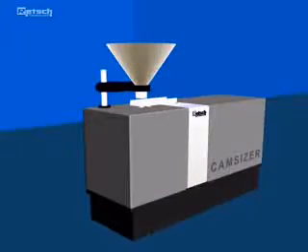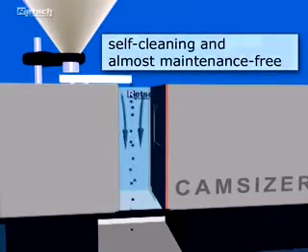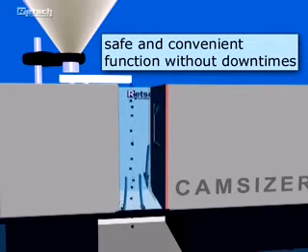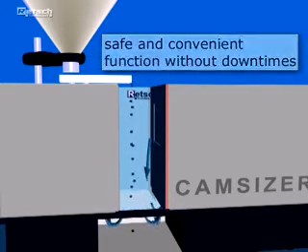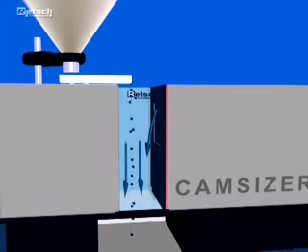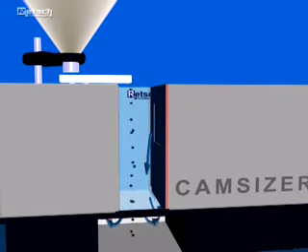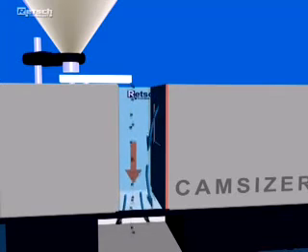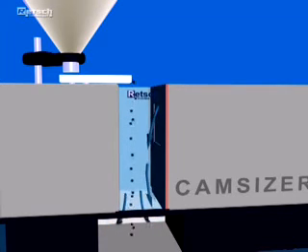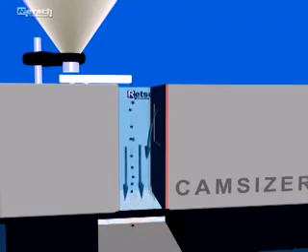The Camsizer is self-cleaning and almost maintenance-free. Continuous air flushing of all optical components ensures a safe and convenient function without downtimes. It even enables an easy measuring of sensitive samples like carbon black without leaving any residues. The air flush also ensures a constant velocity of fall, especially for fine particles, which guarantees an extremely precise analysis.